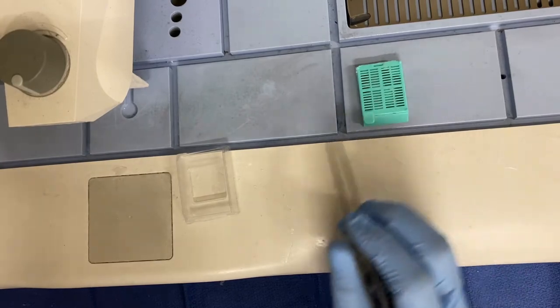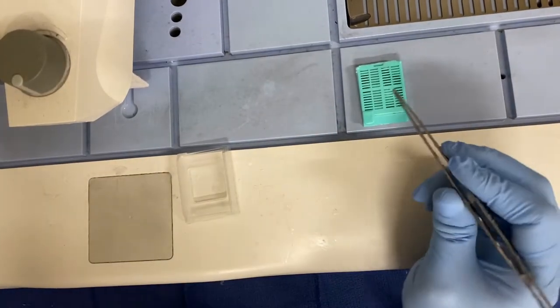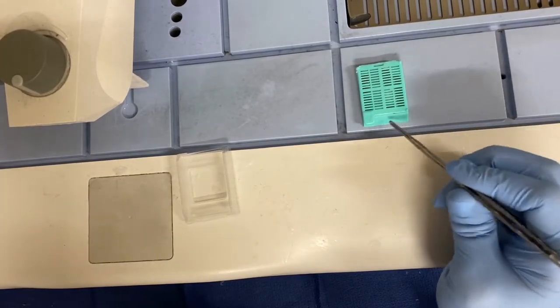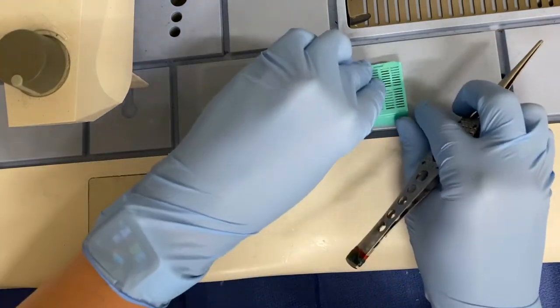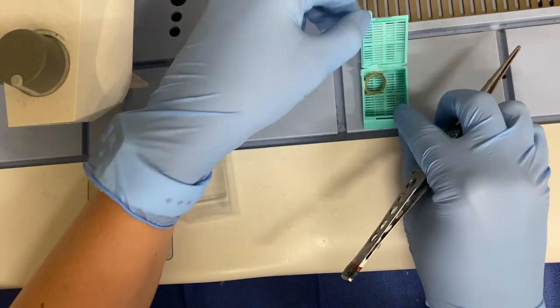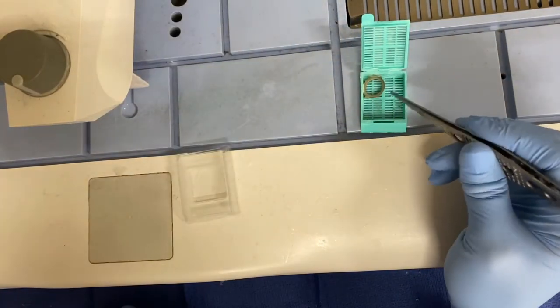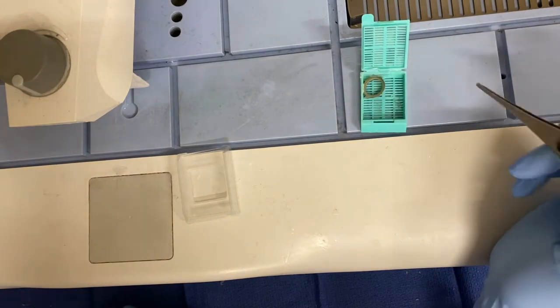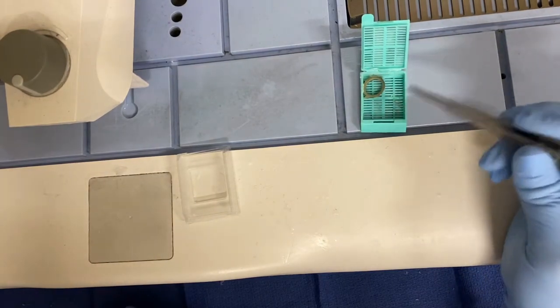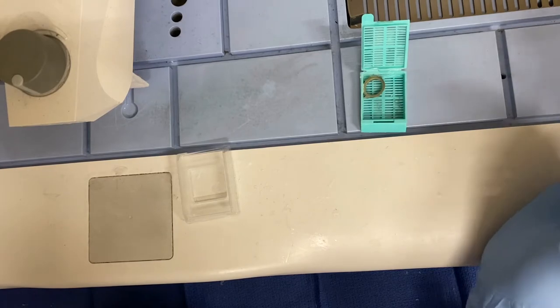We're going to compare that to our cassette log that we get every day. So we're going to have one cassette out at a time, open it very carefully, and verify that our tissue in there matches our cassette log as well—the number of pieces of tissue, etc., depending on your site.